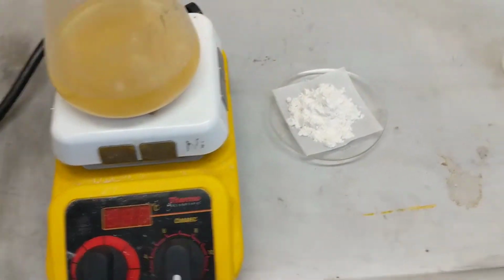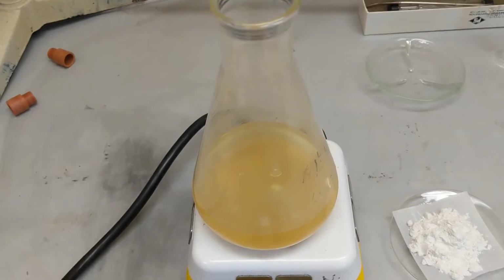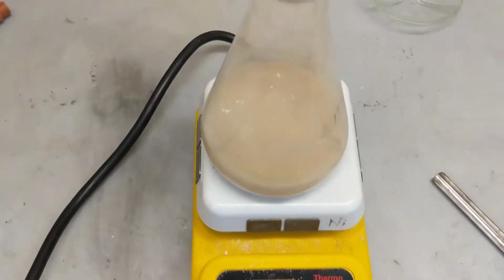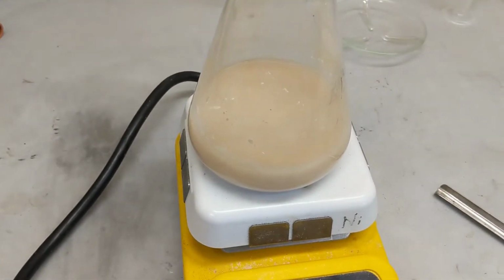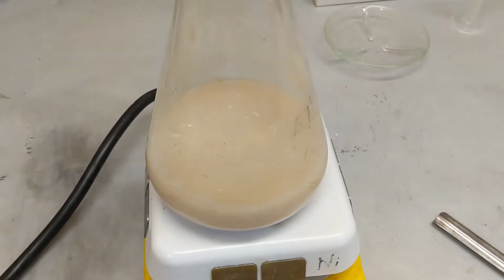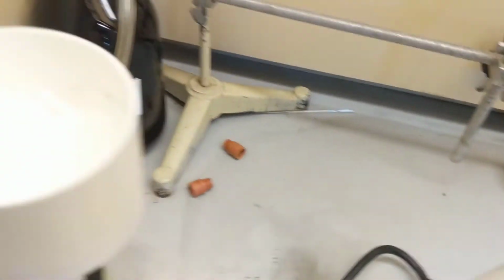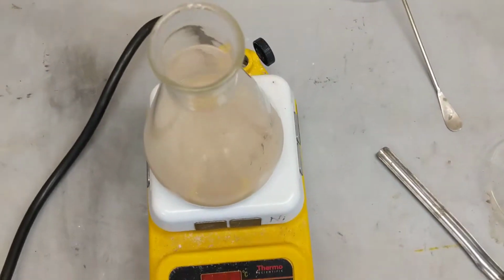Alright guys, I've let this slurry sit for about 5 days. That's my 5 grams of Celite. I'm going to put that into here and stir it for a minute. I'll let you guys see once I get it in. Alright guys, I've added the Celite. It's stirring, as you can see now. I'm going to stir it for about a minute, make sure it all gets incorporated, and I'm going to let it settle until it separates back out into solids and liquids. And then I'll use my Buchner funnel. Alright guys, it's been stirring for a minute, so I just turned it off.